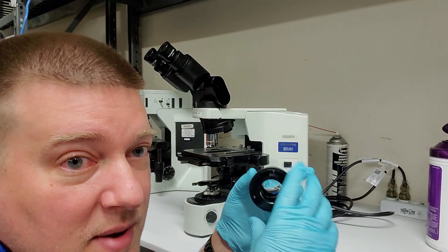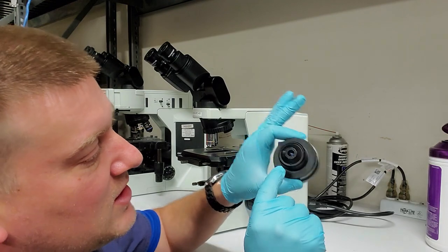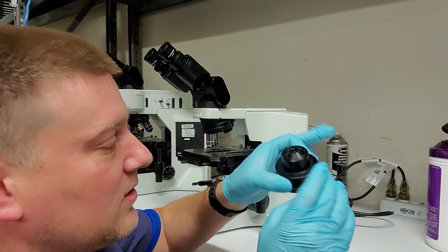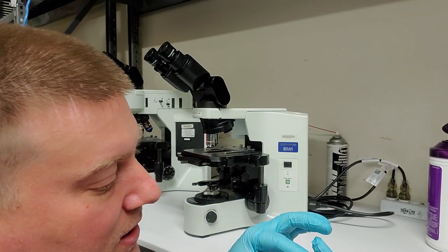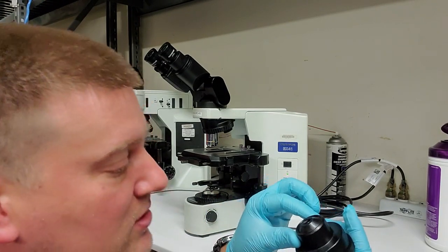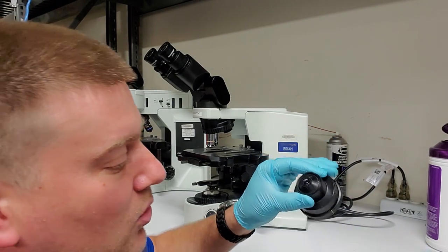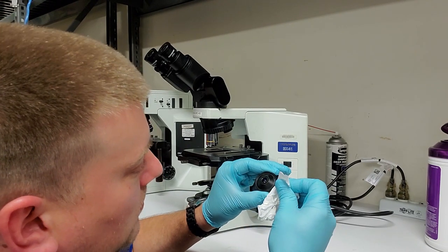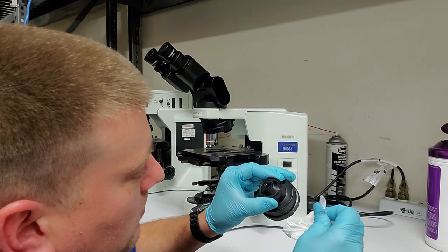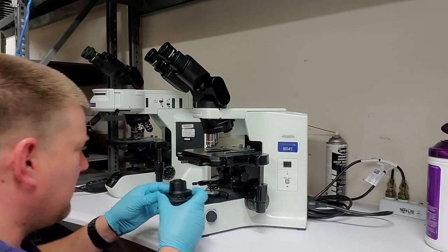Don't shove anything on the back side of this because it should be clean. So the surface that you're going to want to clean is this end right here, which is the side that faces your objective. And I scrubbed a little bit of weird stuff off the surface of it. And then you hold that at an angle, make sure that there's no rainbowing. Oh, it looks good. Looks really good.